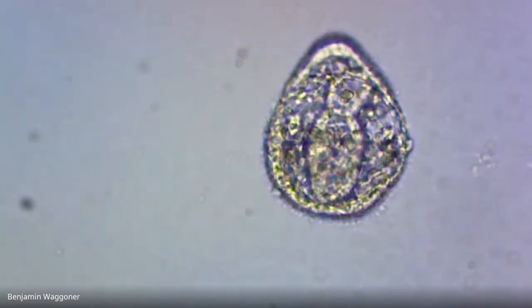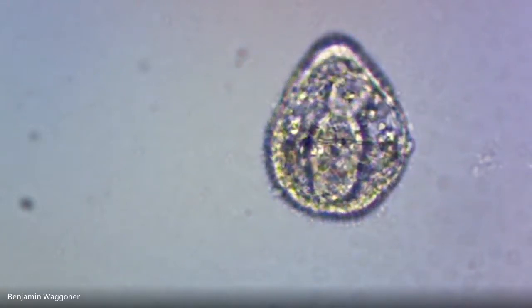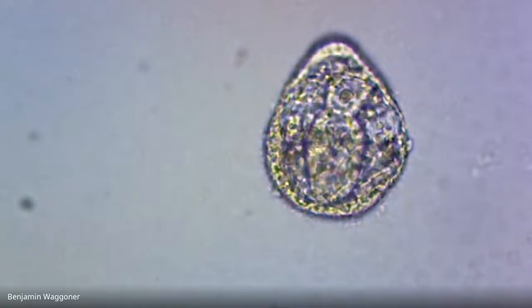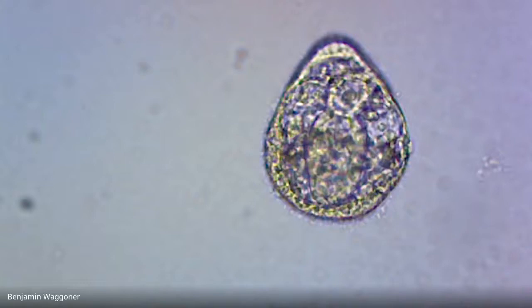And that one, yeah, you can see the anus down at your 6 o'clock, and the mouth is coming in at about the 11 o'clock. So there's that complete gut. And the whole larva is taking that kind of pyramid shape. From this, if it were going to transform into a pluteus, it would grow some arms, but that has not happened yet.